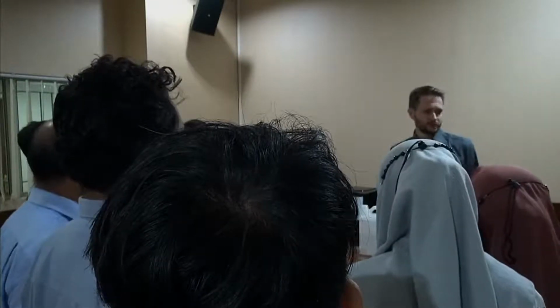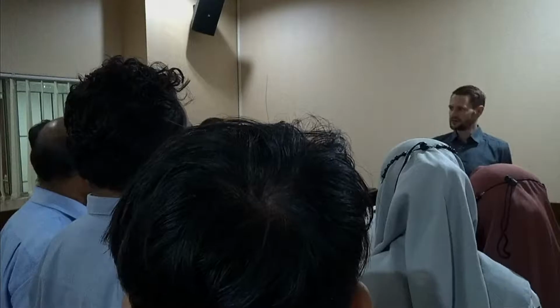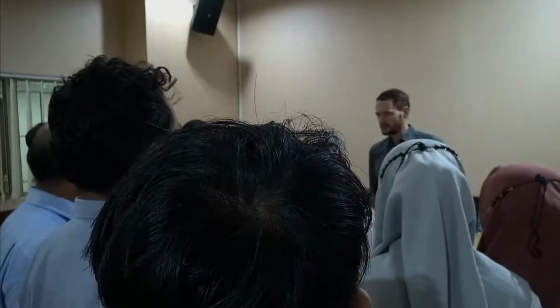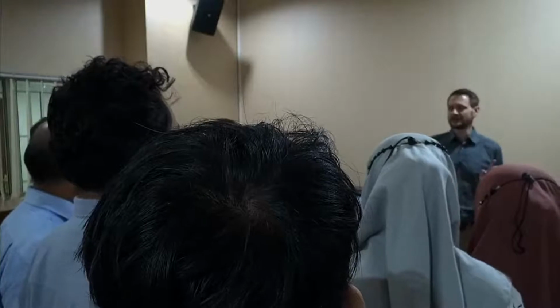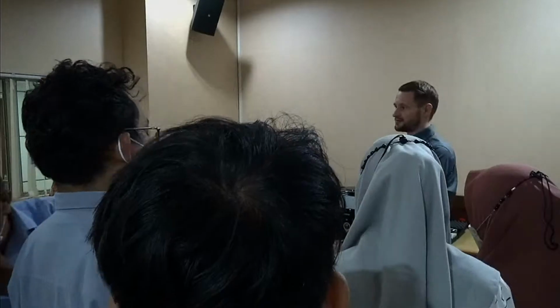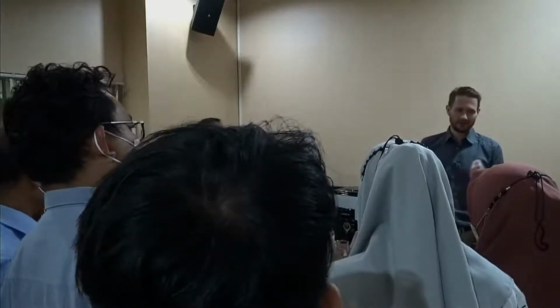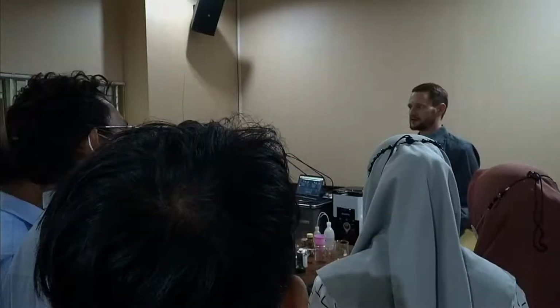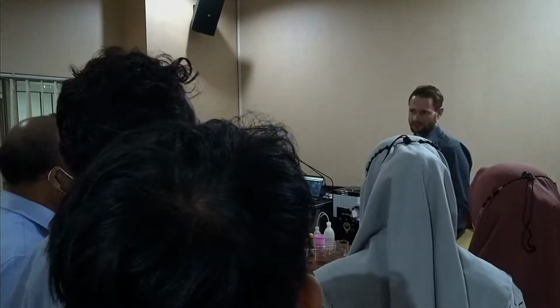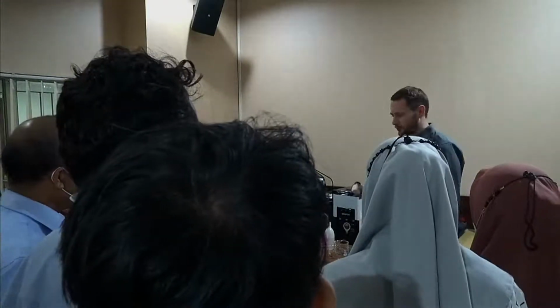Why we give you this: you could of course use one of the NIST traceable standards, which we use for calibration, and measure that. But that will make us very happy, but not you, because these come very expensive. Just a single measurement of one standard will cost you at least 100 euros, minimum. So if you waste it, if you make any kind of mistake adding that sample, you wasted 100 euros. If you want to do that once a year with all the NIST traceables, you see the cost is amounting. I mean, this instrument doesn't come cheap. It's not for free. We know that. So what we want is you buy it, and then you're happy for the next 10 to 20 years.